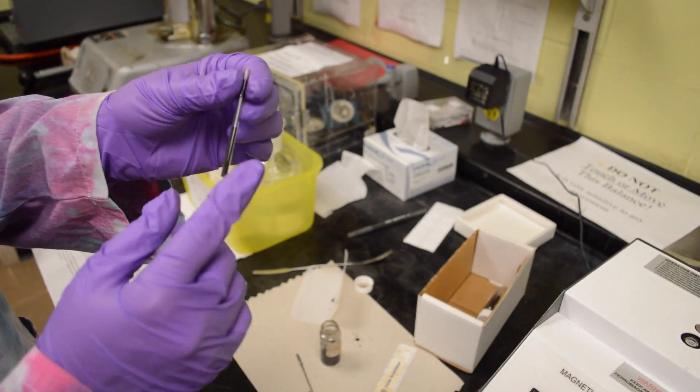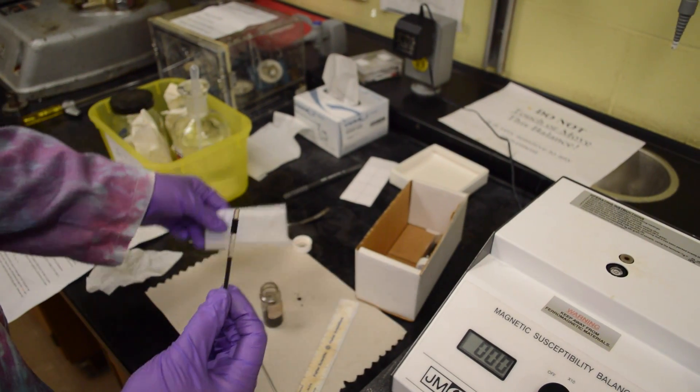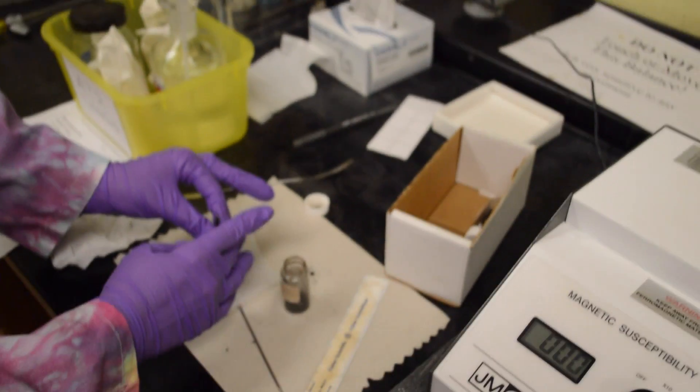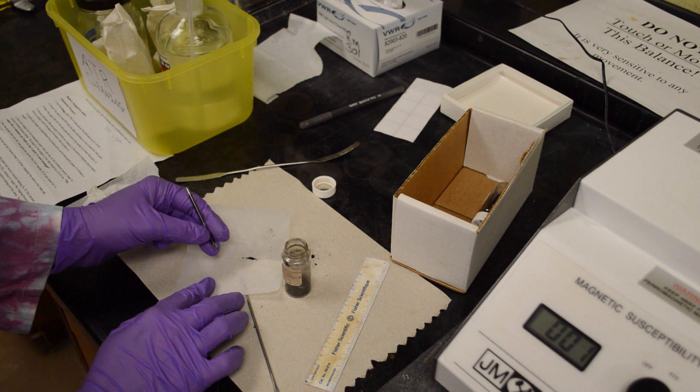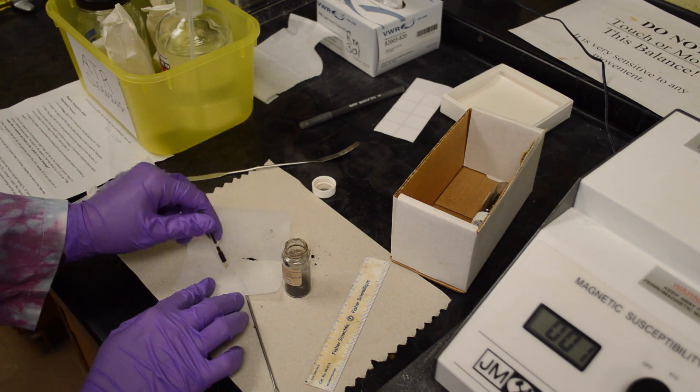From there, put this sample back by emptying it on a piece of weigh paper that is folded in half. When removing the sample from the tube, make sure that you tap it gently as they are made of glass and we do not want them to break.